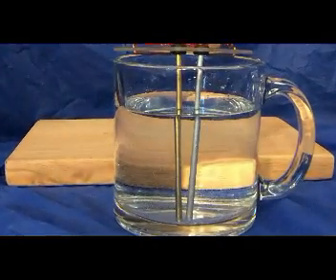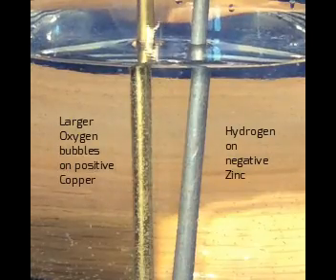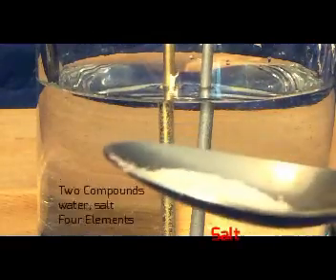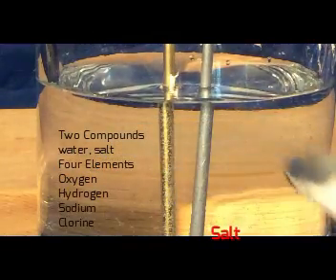The little one is hydrogen and the big one is oxygen. We're adding just a little salt in the spoon. The preparation is salt in the water — you can see it fall through the water.